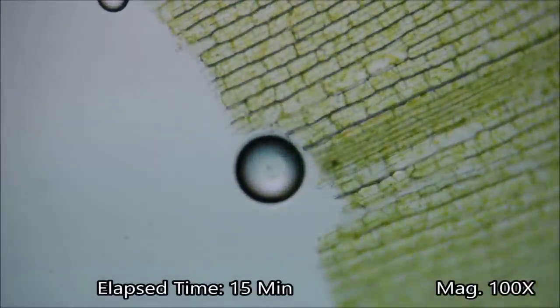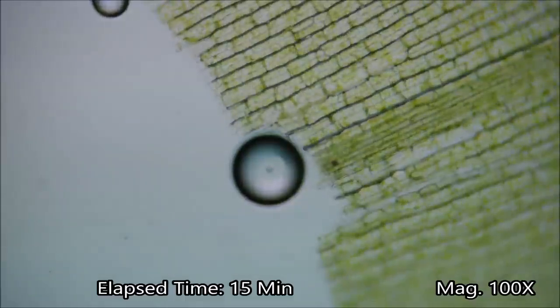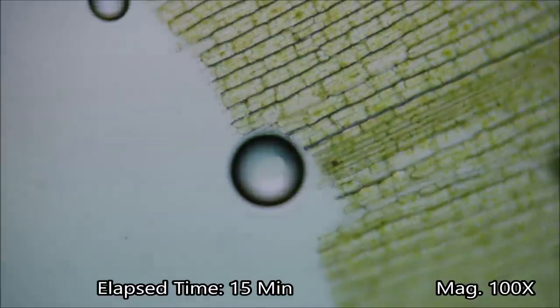Here we can see an oxygen bubble growing and the chloroplasts in the plant cells moving around.